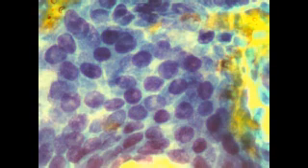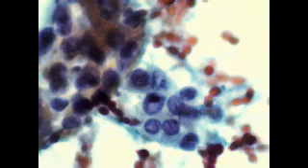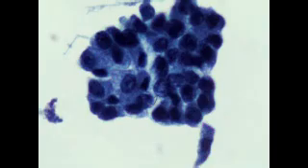Based on the microscopic description, as we were called in by the radiologist, we were able to pin down the PTC right away due to the classic features that we were able to see. I am going to present those features to give you an idea of what PTC looks like.